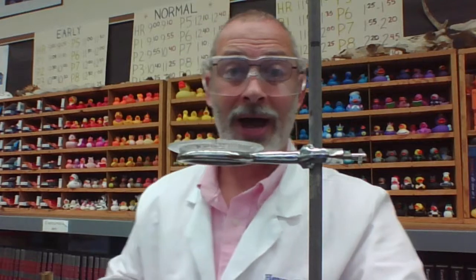For now, I'm going to allow this glass evaporating dish, and by the way, I'm not as close to it as it might appear on the screen, because that glass evaporating dish is very hot. So I'm going to allow it to cool before I clean it off. And so I'd like you to complete your conclusion.